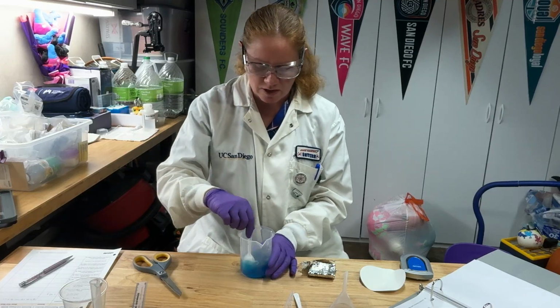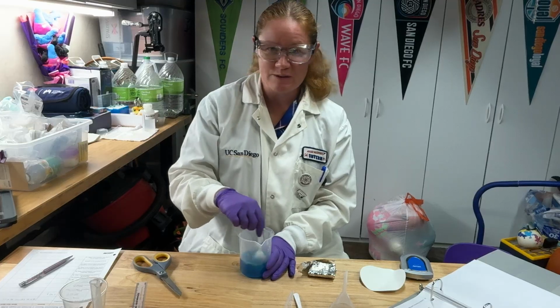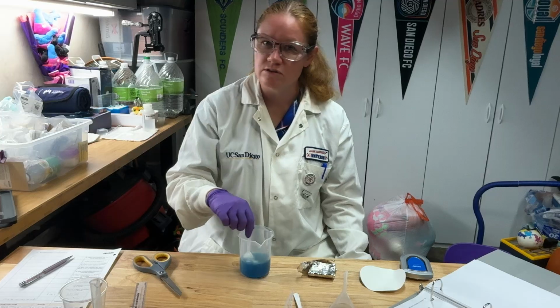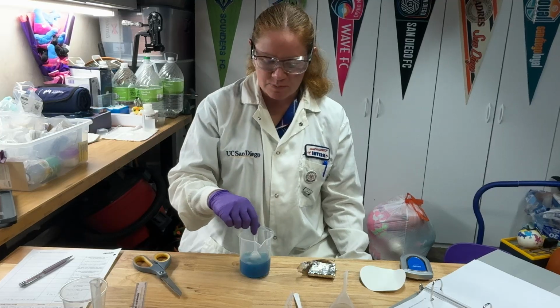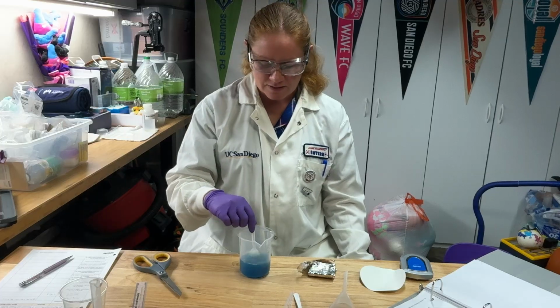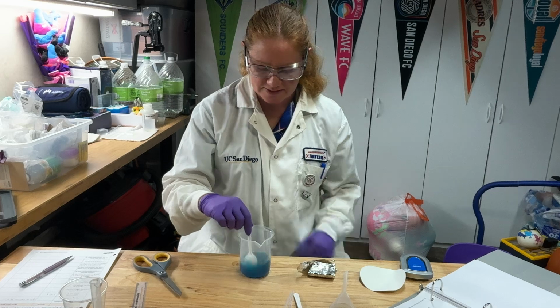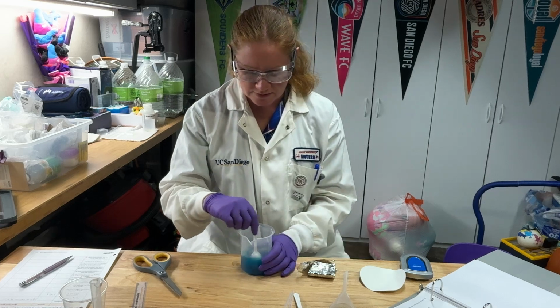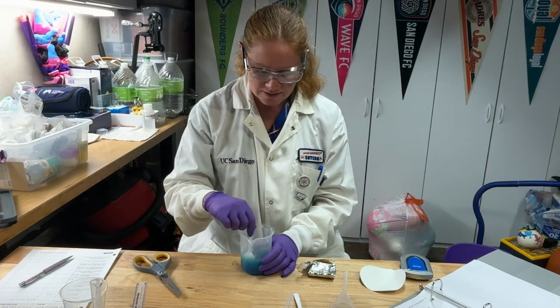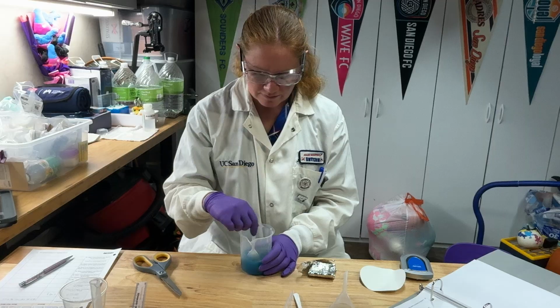And again, as you go, not only will you see the aluminum dissolve, not only will you see the solid copper forming, but the blue color of the solution is due to that copper 2 ion. So as you precipitate out the copper, the blue color will go away. The aluminum ion is colorless in solution. All right, so you should hear some fizzing. You'll see some bubbles. All right. And you'll just keep going until you manage to get all of that to dissolve.